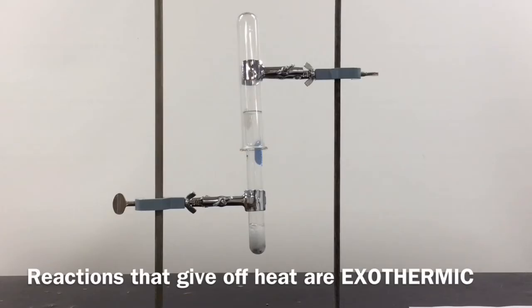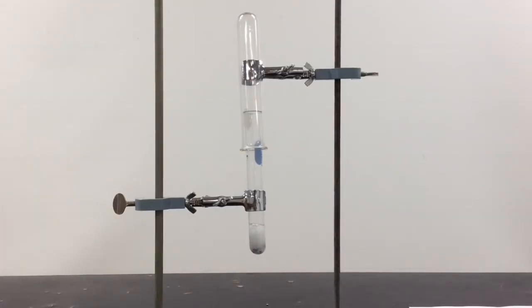So I'm making quite a bit of hydrogen here. All those bubbles of hydrogen are being produced. Now, when I'm satisfied that I've made enough hydrogen gas, and I think I've made quite a bit, I will let this run a little bit longer. I think that's probably good enough.